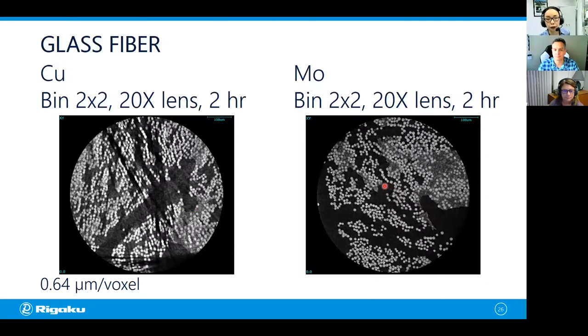This is a scan we saw in part one when we're using molybdenum. You have a good contrast between the resin, the glass fibers and the air, and you don't see any sign of beam hardening artifacts. So you got this one right. Molybdenum works better for glass fibers because they're more absorbing. The density is about 2.4 grams per cubic centimeter.